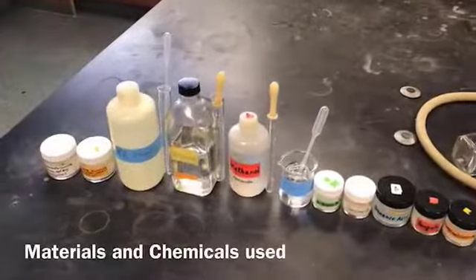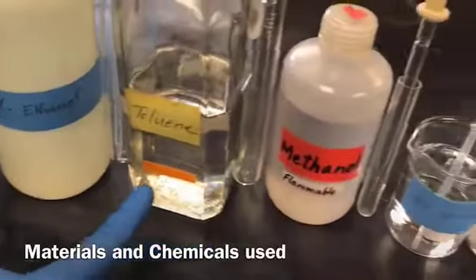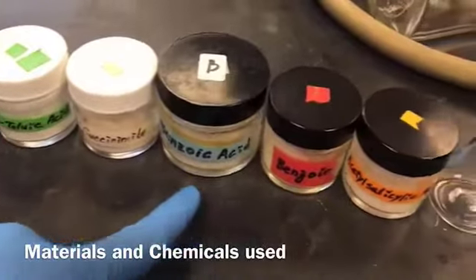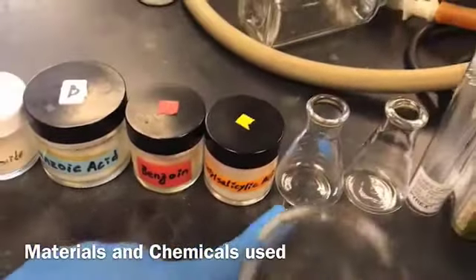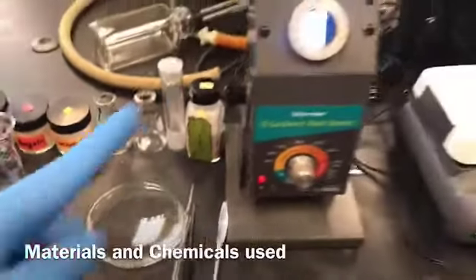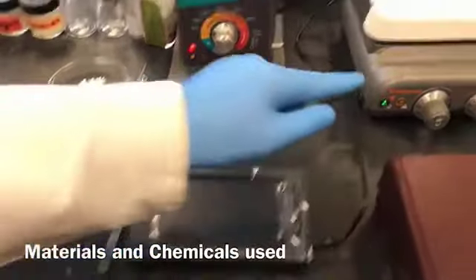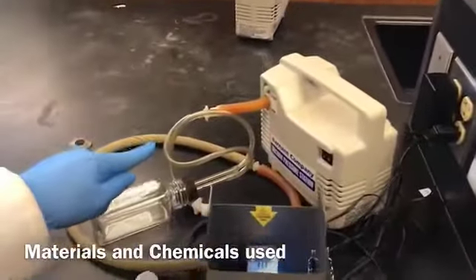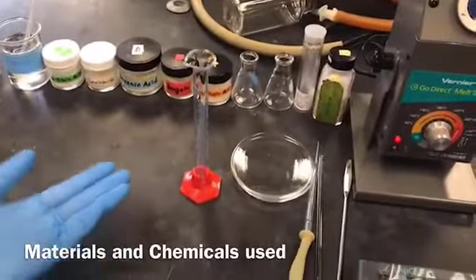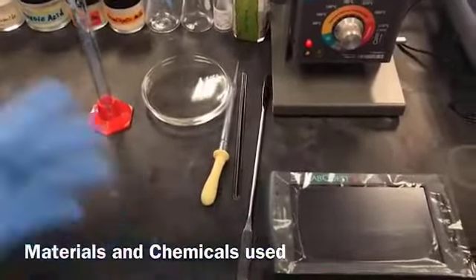Materials and chemicals used for this experiment: impure sulfanilamide, impure fluorene, 95% ethanol, toluene, methanol, deionized water, o-toluic acid, succinimide, benzoic acid, benzoin, acetylsalicylic acid, Erlenmeyer flasks, melting point capillary tubes, boiling chips, melting point apparatus connected to a data recorder, hot plate, vacuum pump for vacuum filtration, and the Merck Index for part D. You will also need other things from your lab drawer, for example, measuring cylinder, watch glass, pipette, glass rod, spatula, and maybe some more.